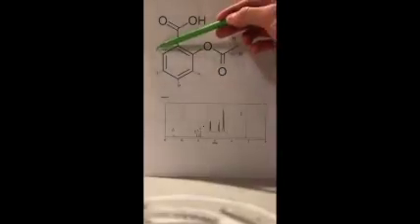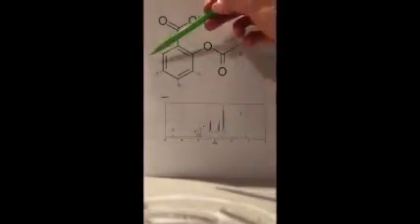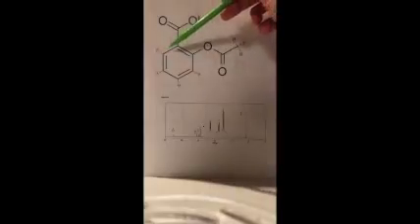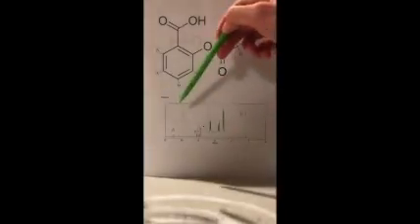So like I said, this one corresponds to B, and then this hydrogen over here corresponds to C, so it is just slightly further upfield than B, just because it is a little bit further away from the oxygens in terms of counting the atoms away from it. So we have 1, 2, 3, and then 1, 2, 3 away from the oxygen, and this one is just 2 away, which is why it's going to be further downfield.